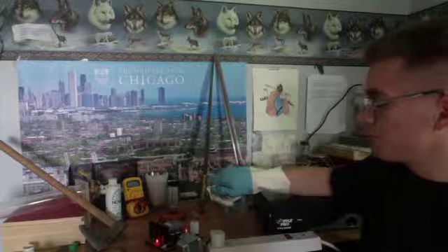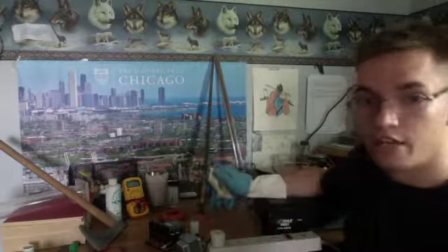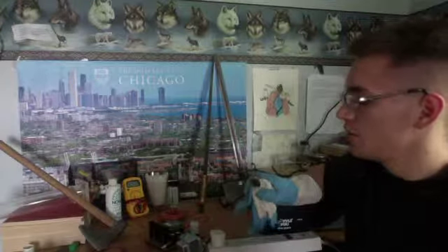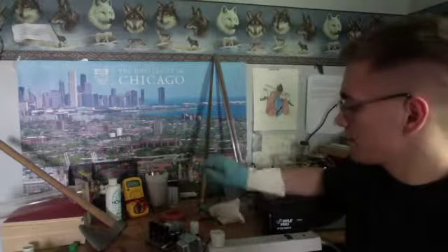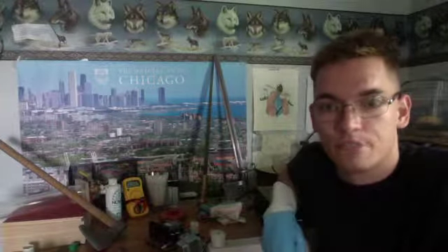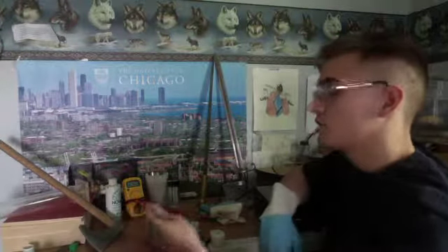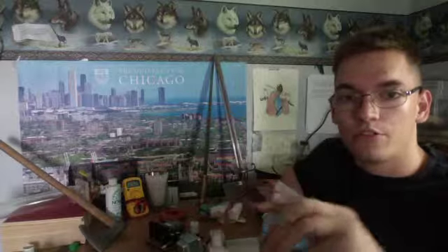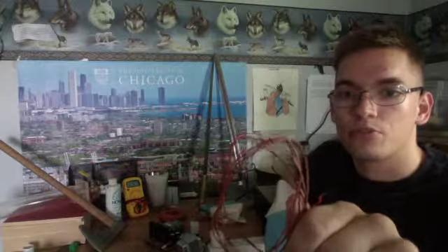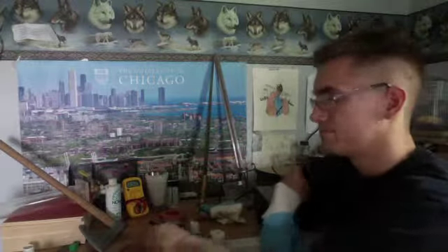It can form up to 1-inch streamers at times, and with proper exposure, it will eventually create a coating of copper oxide around it. It's believed that it's 2 copper to 1 oxygen. The resulting product will eventually look like this here, which you can see the red coating on what is otherwise normal copper. Thanks.